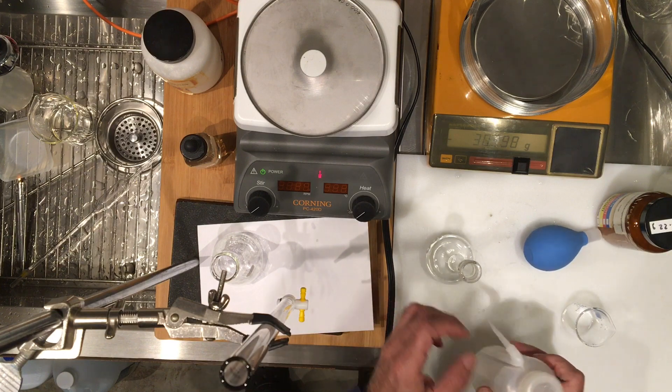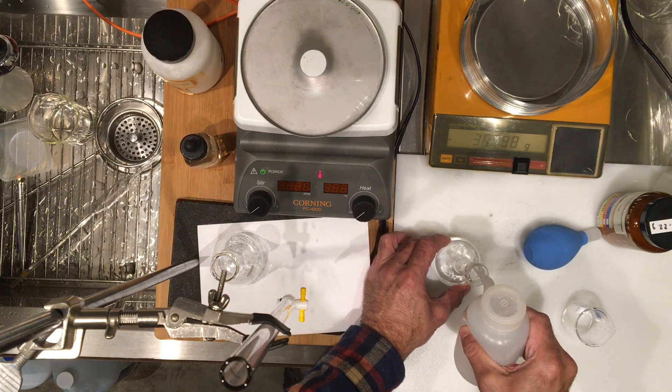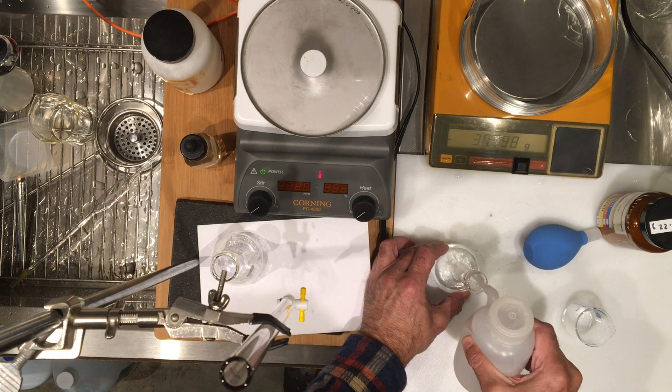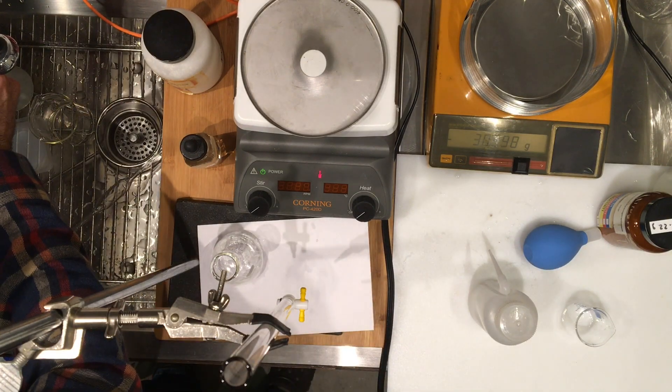Okay, and now I'm going to fill this flask with DI water to the mark, so I'll do it a little quicker using my DI water tap.